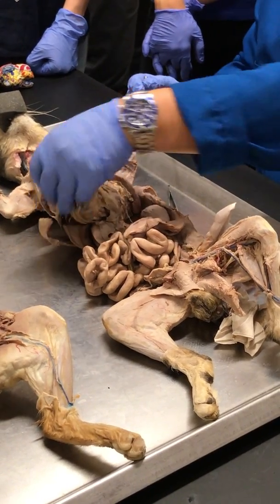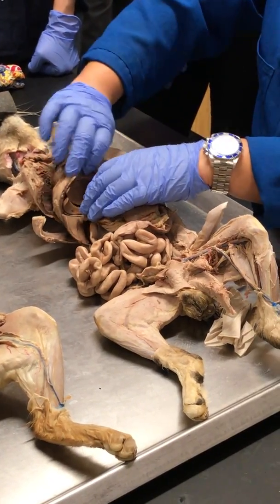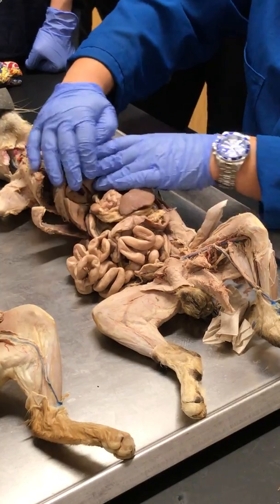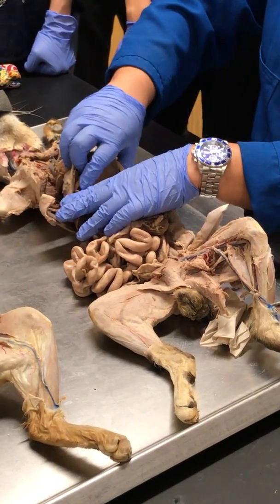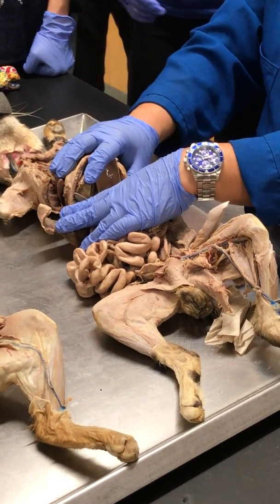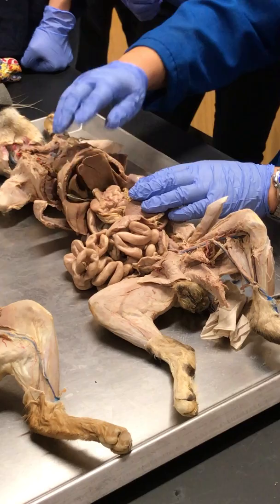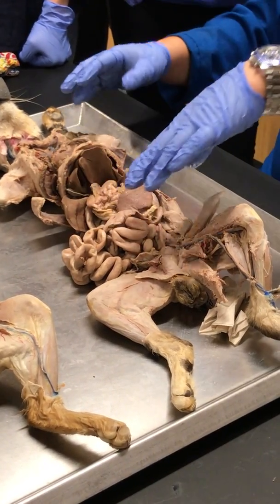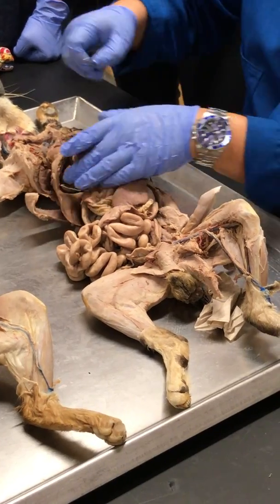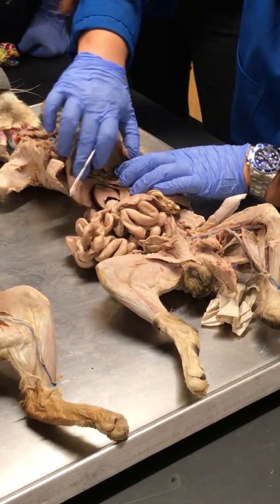Okay. This way, you now get to see this big organ known as the liver, and if I move this stuff around, do you see that sac right there? That's the gallbladder, right? See that? No, I'm not going to ask you the names of the lobes of the liver. I don't know for lecture. Yeah, that's the gallbladder, and on this one I kind of showed the cystic duct.